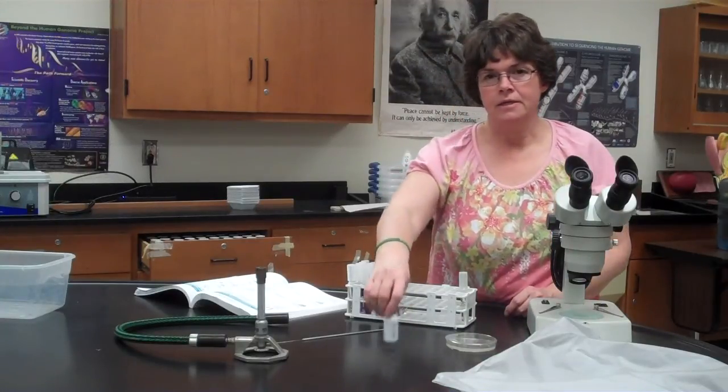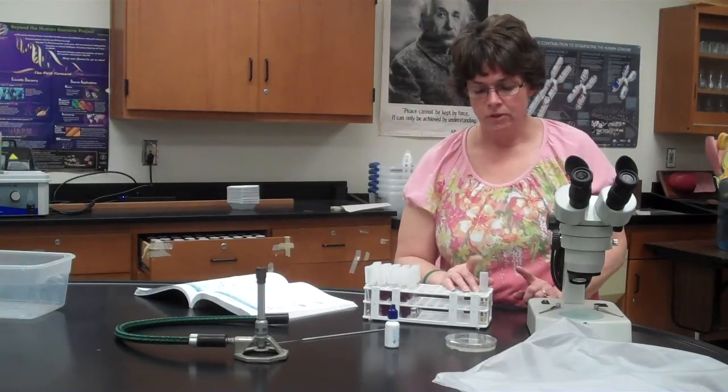In that case, you're going to try to spread it out as much as you can in the stain before you put the cover slip on. Then that is what you're going to look at with your compound microscope to get your microscopic view. Okay, so you're going to be looking at the view on the plate, and then you're going to be looking at the view at the microscope. By the end of the lab, you should be able to identify to the genus level which one you had for your particular unknown.